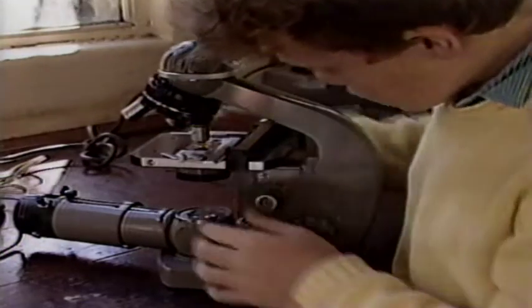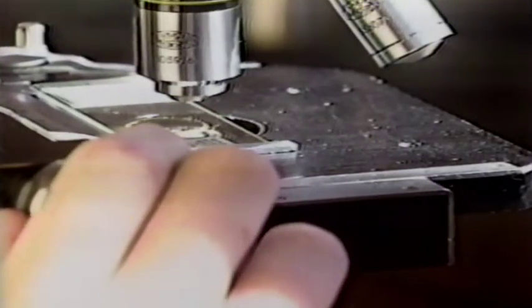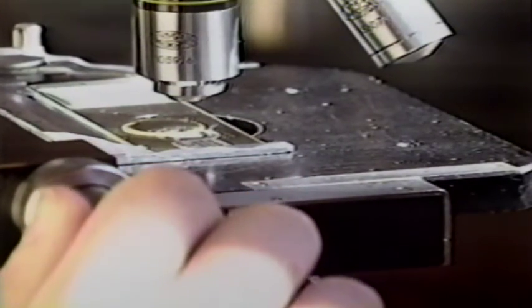A slide is placed on the stage, and the retaining clips are used to hold it in place. The two slide positioning knobs are used to move the sample around in the beam of light. In the absence of slide positioning knobs, the specimen can be located by moving the slide by hand under the low-power objective. Finding the sample can be frustrating at first because the system of lenses reverses your movements. When the slide is moved left, the image moves right. And when the slide is moved away, it appears to move toward you. With practice, you will get used to this effect and will be able to locate the unfocused object.